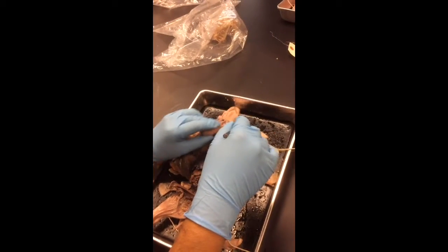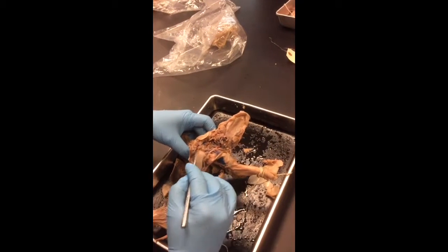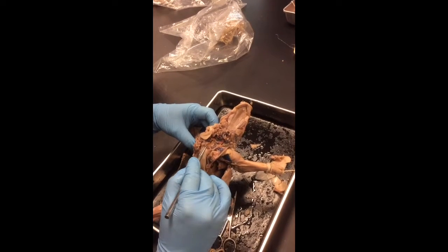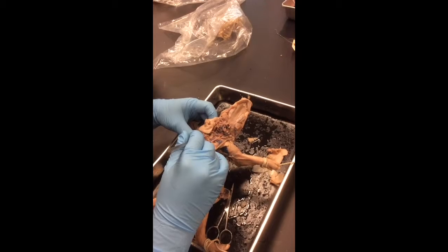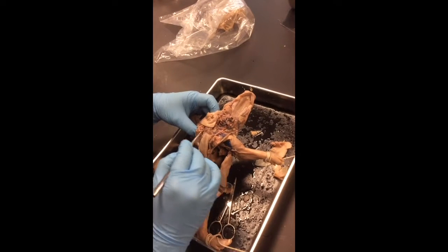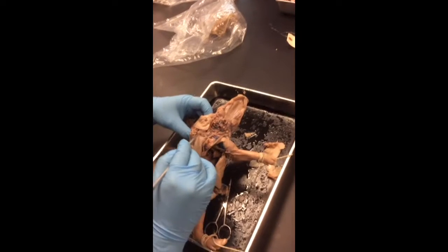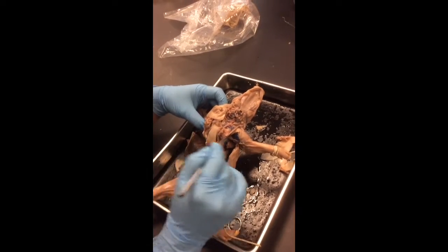Glottis. So glottis, I can't really pin, right? Because it's just the hole where the epiglottis is, right? So here's the epiglottis. You guys remember this structure here? It's a little flap. The glottis is the hole. We won't be pinning that. But the epiglottis is the flap itself, and we do usually pin that one. And we'll pin right through it. So if you see something in the back of the throat, epiglottis.